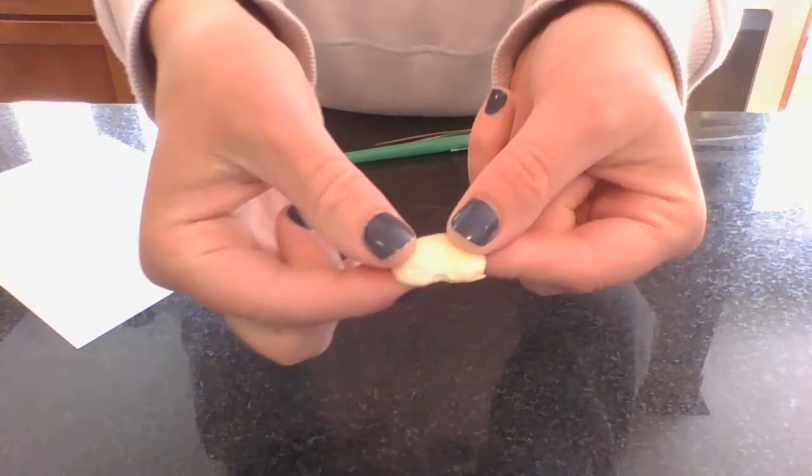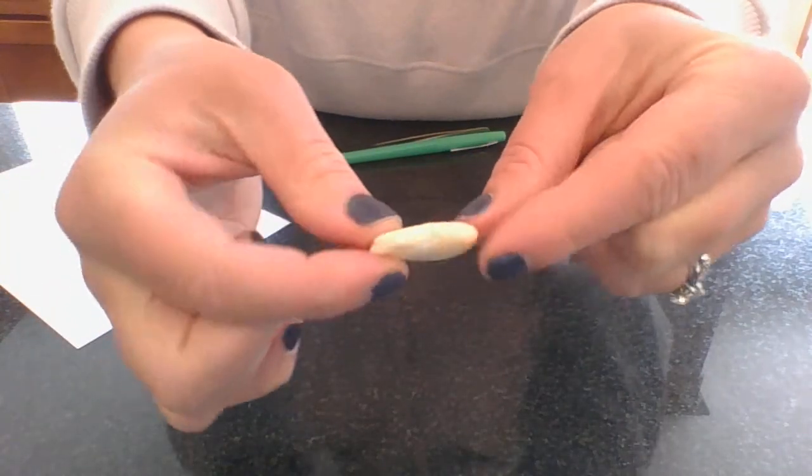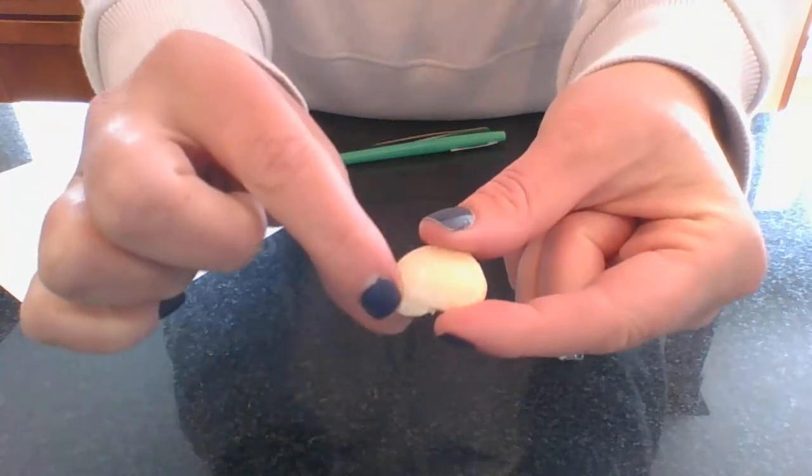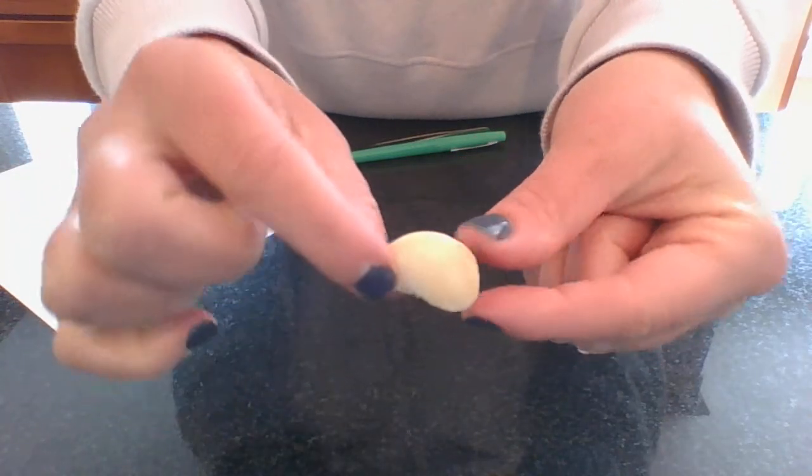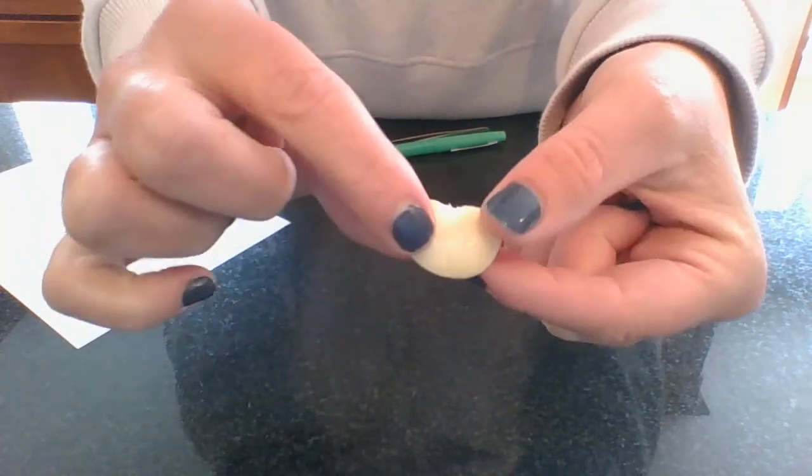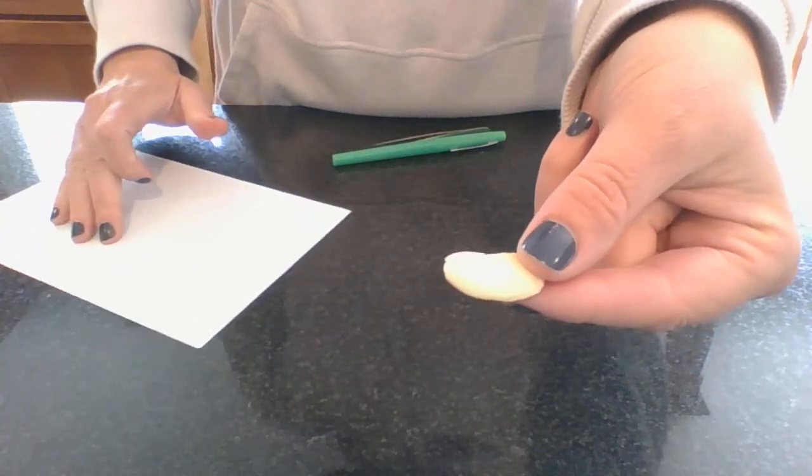So I soaked this lima bean in water for 24 hours so that I can dissect it and show you the different parts of a seed. There are a few different parts of a seed.